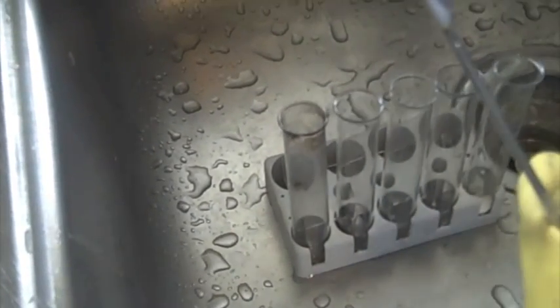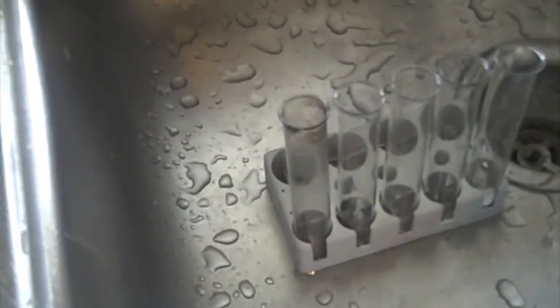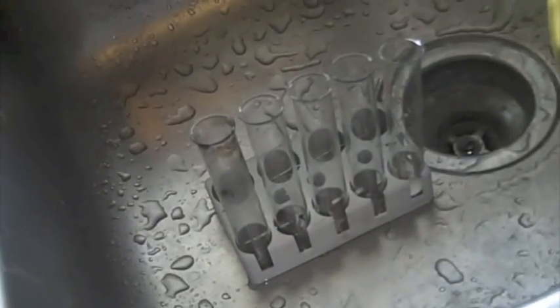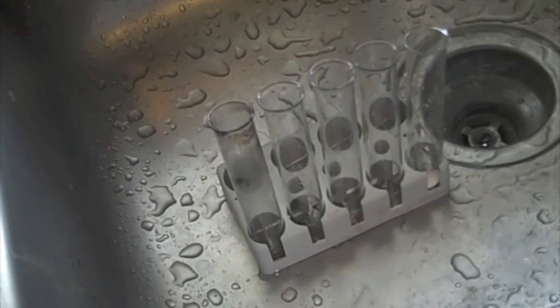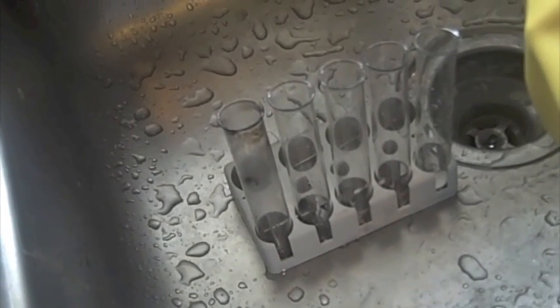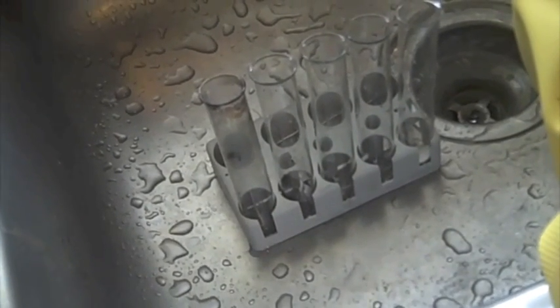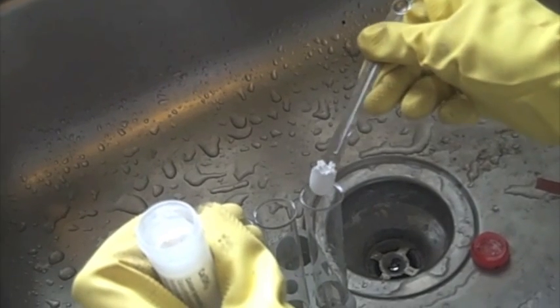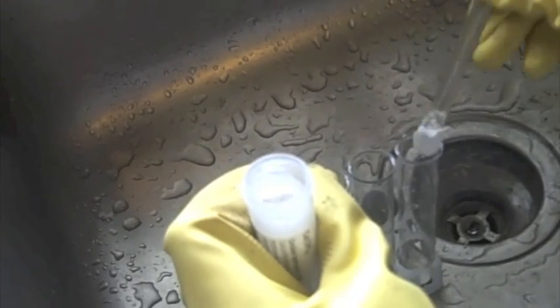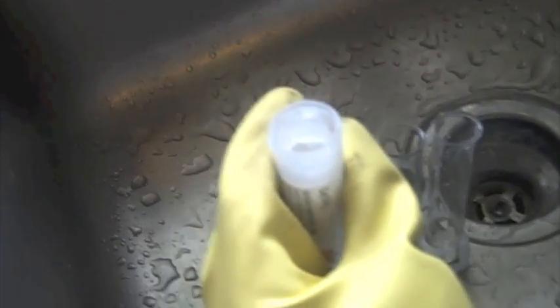Right now I'm getting my calcium hydroxide container and I'm washing my measuring spoon. So there's my calcium hydroxide and I'm going to put two spoonfuls of it in the same test tube with the sodium carbonate. I'm just going to put it in. Just a little more. Closing that.